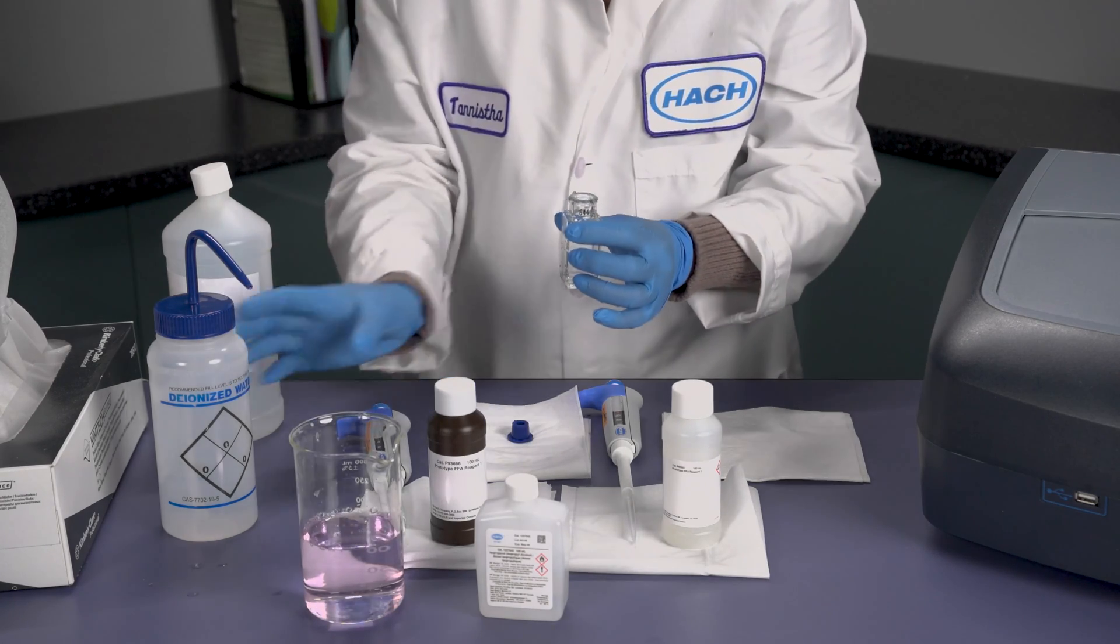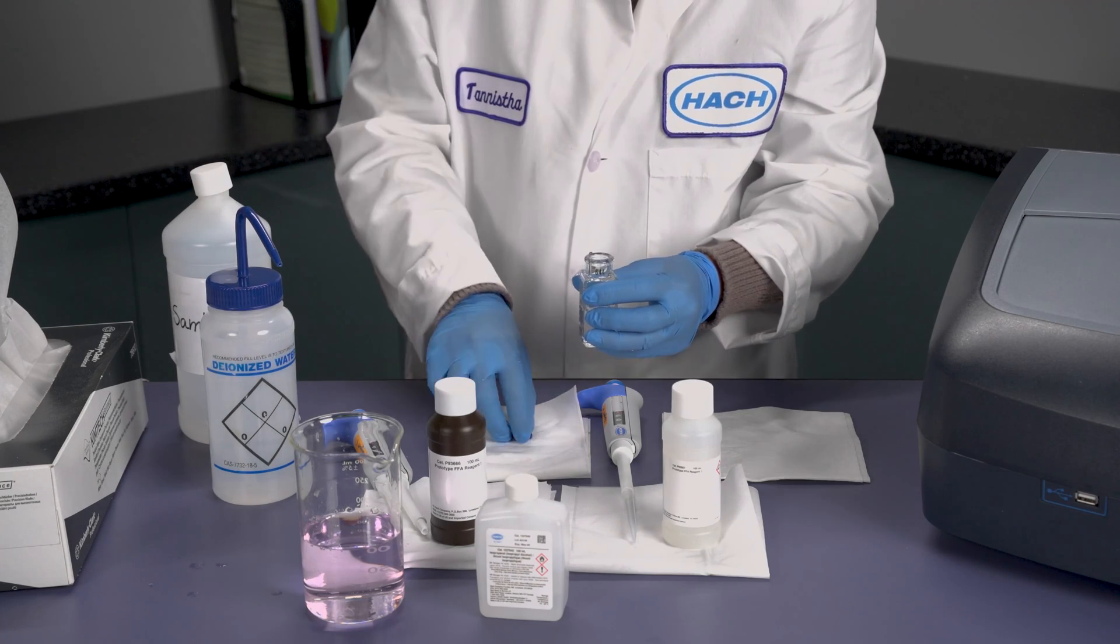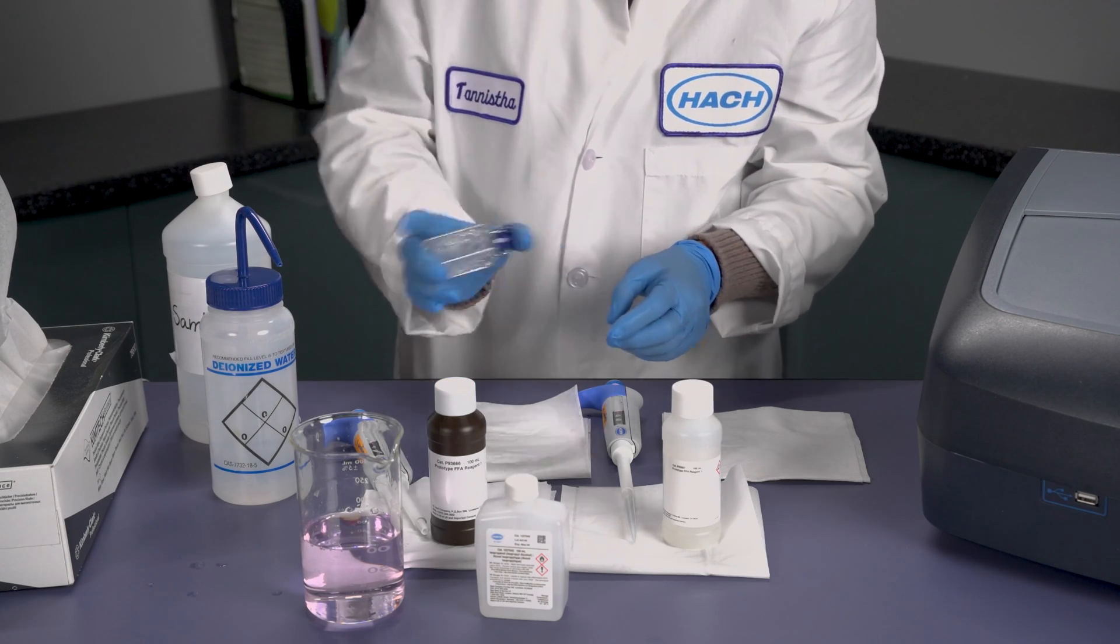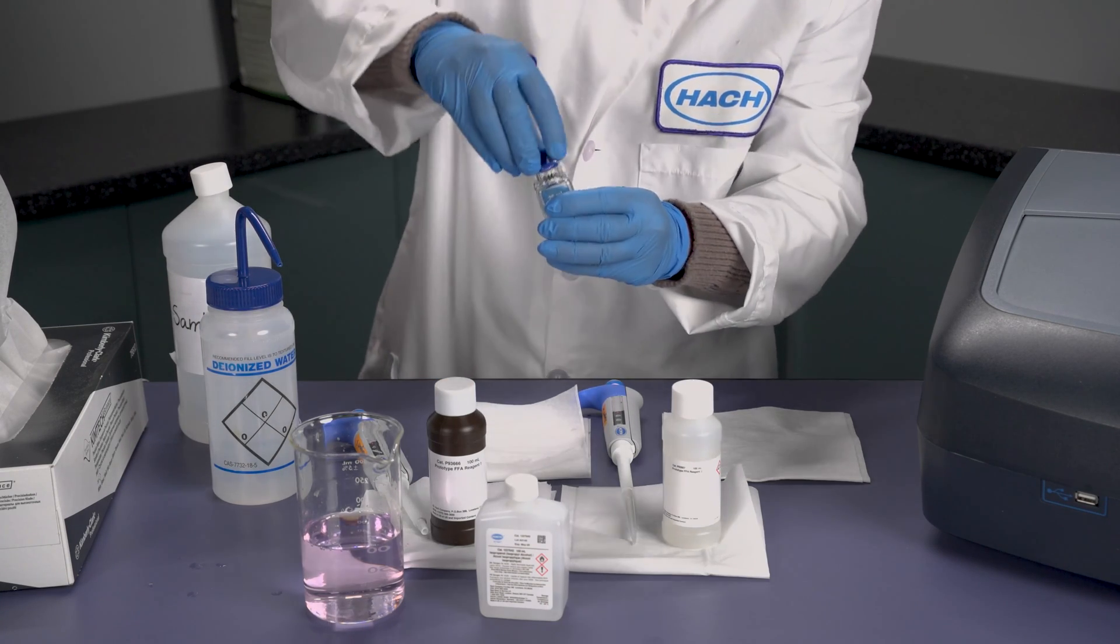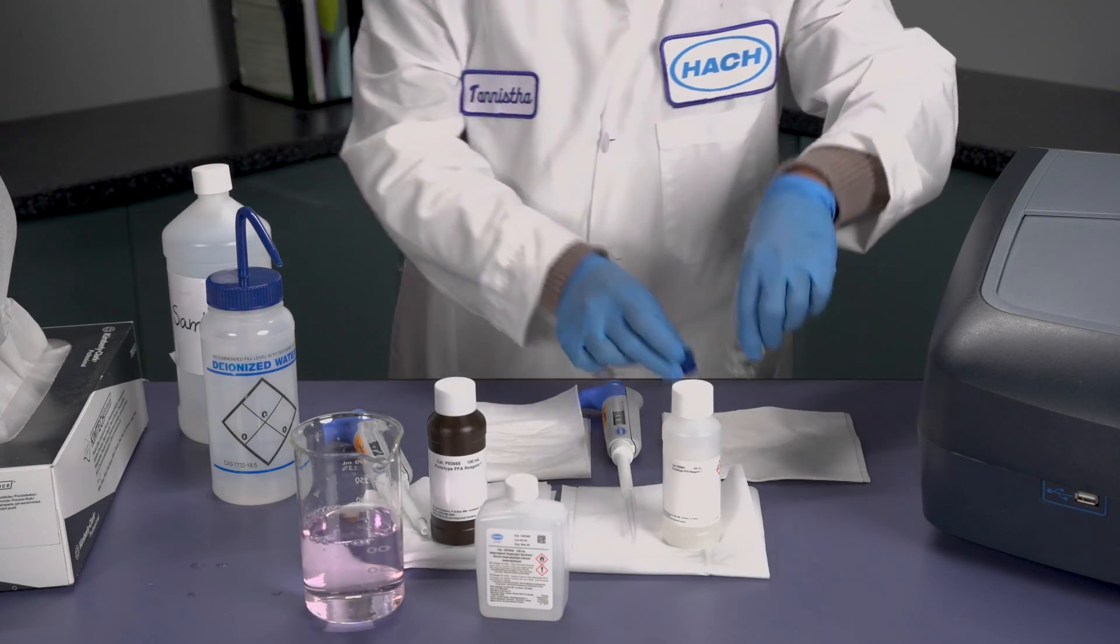Once you have finished cleaning the sample cell, you can now use it again for the next test, or if you're going to have a time period between tests, ensure that you store the sample cell and the stopper in a way that they do not become contaminated.